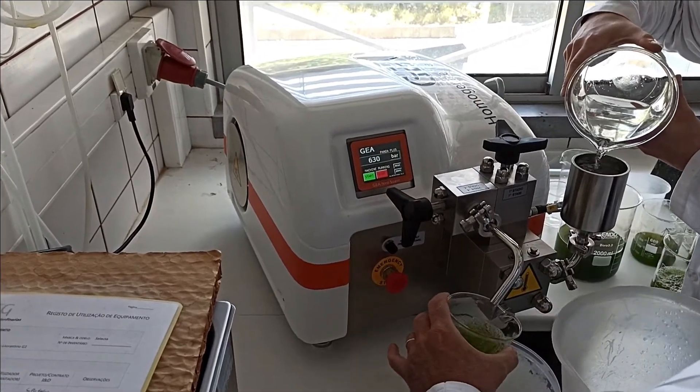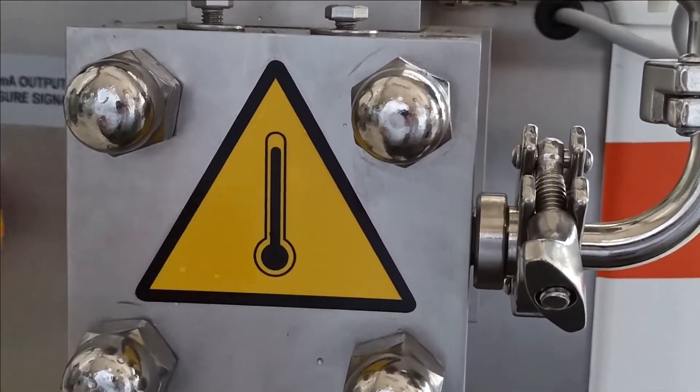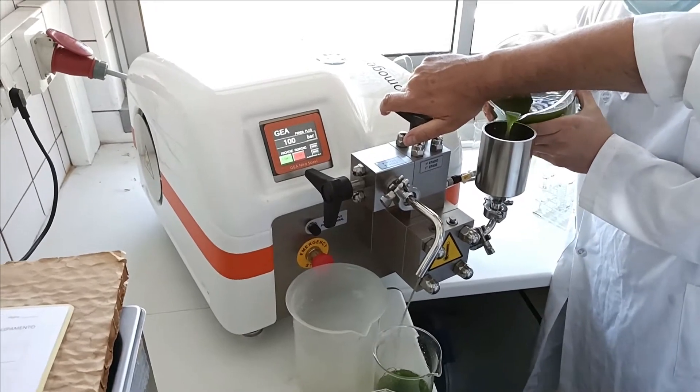Keep checking the pressure, as it often deviates after the culture enters the compressing cylinder, so adjust it when necessary.